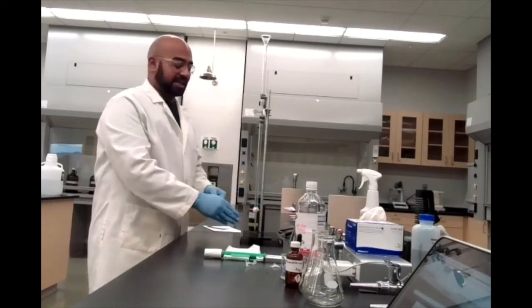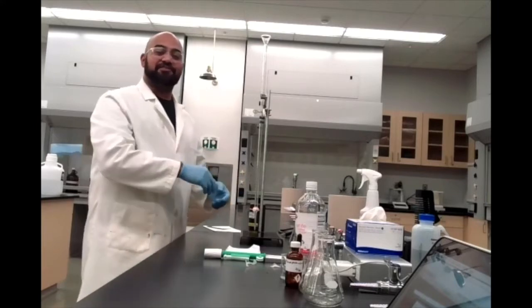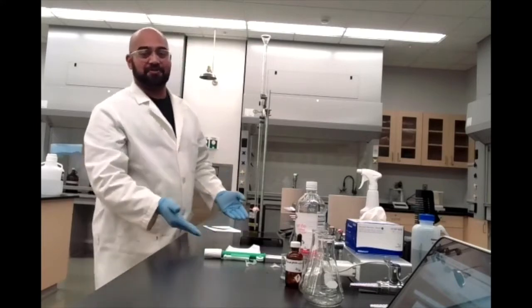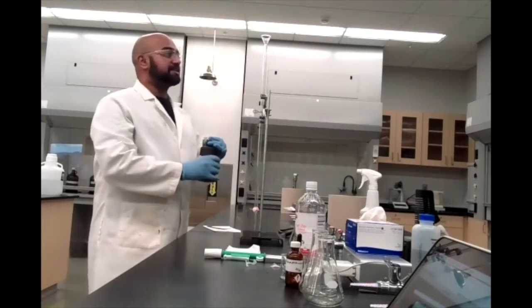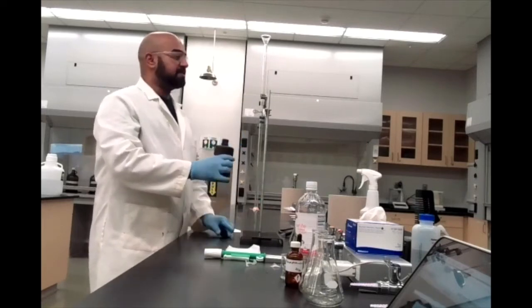All right, and so you definitely want to have that closed for obvious reasons when you're pouring sodium hydroxide in there, right? You don't want it to drip through everywhere. So let's go ahead and pour our sodium hydroxide in.